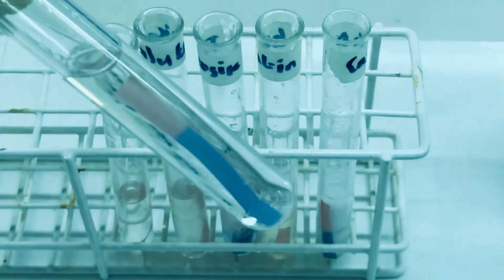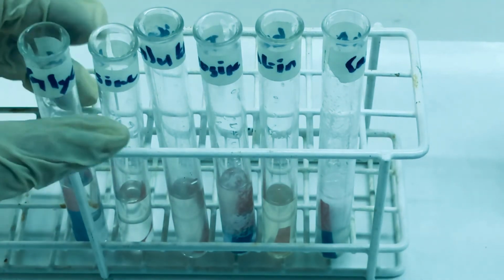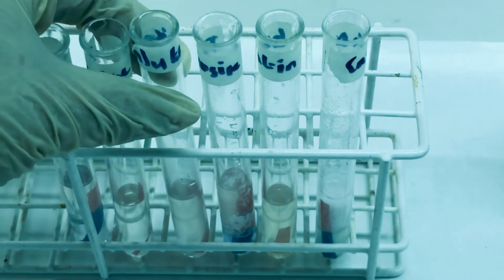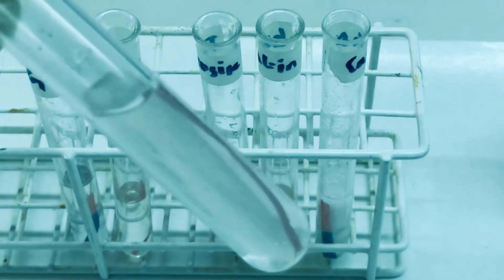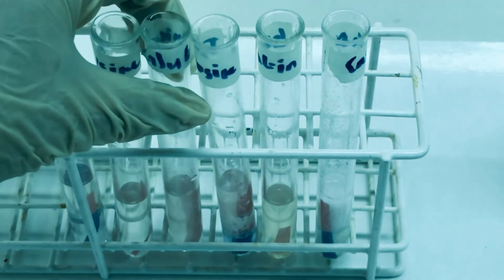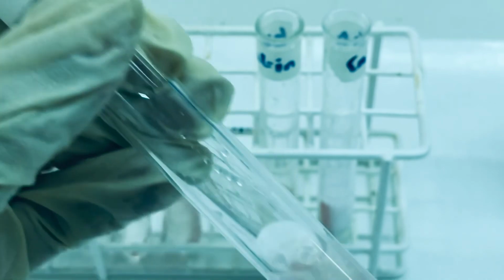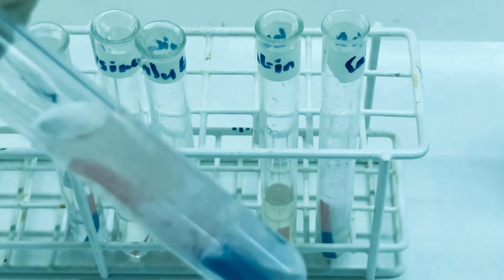For glycine, which was already soluble, it has not caused much of an effect. Lysine also remained soluble in both the mediums. For glutamic acid, we saw that it became more soluble on addition of HCl solution. However, the opposite was seen in case of tyrosine. The solubility decreased as a function of acidic pH.